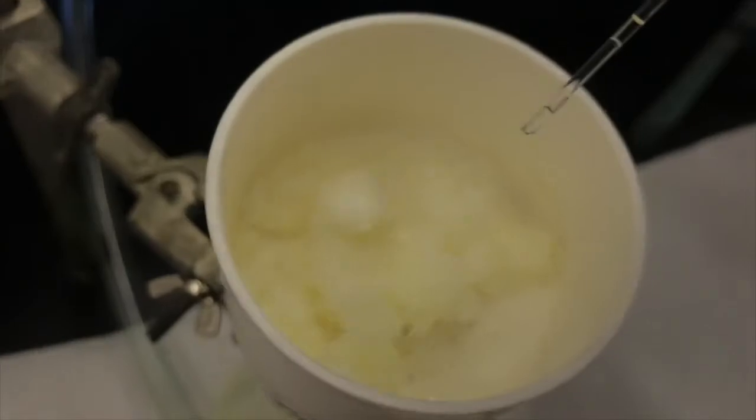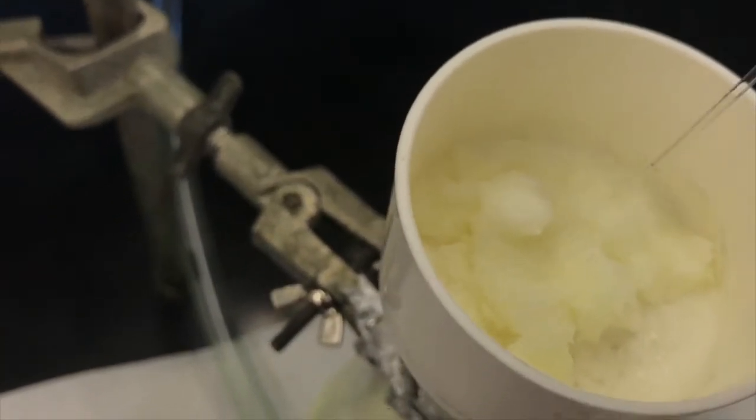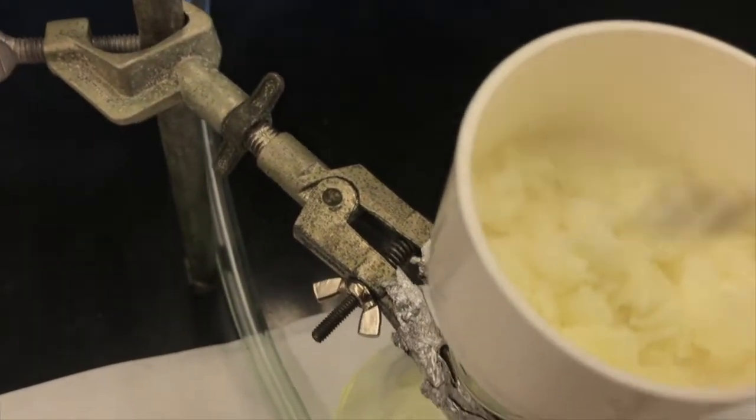I don't want to add too much. I could add more because as you can see there's still a few more crystals inside of this flask, but I'm going to not. Every time I add more ethanol, I dissolve the product as well as clean it. I'm just going to add a little bit more, rinse off some of that mother liquor, and I think I'm actually going to move these around a bit. Move them on the filter paper a little more, break open the big pieces. There we go.